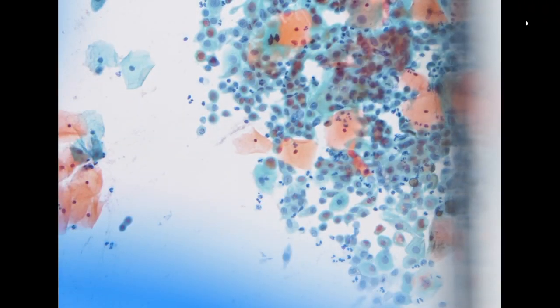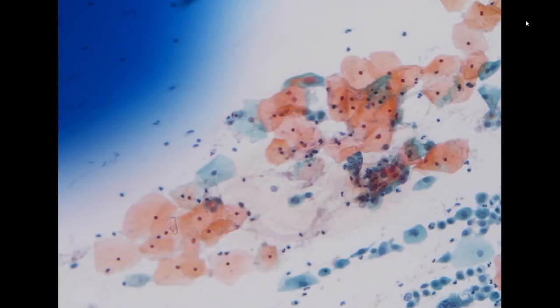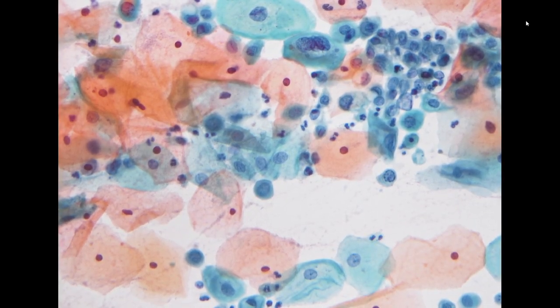The other dots don't fit, and are probably not squamous cells, maybe glandular cells or another cell type. And here is also immature squamous metaplasia. We have a few atypical immature squamous metaplastic cells, some with binucleation. So the best we can give is atypical squamous cell, and it is not qualified for LSIL.